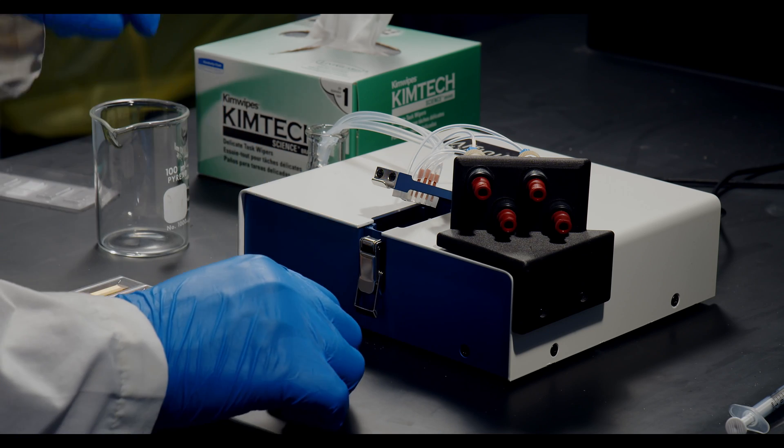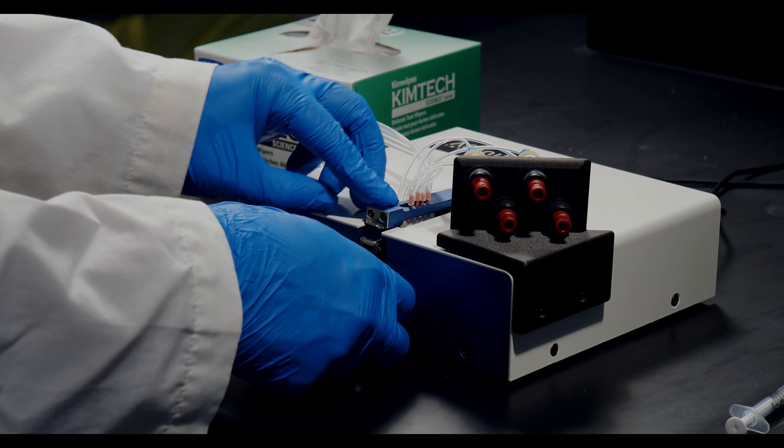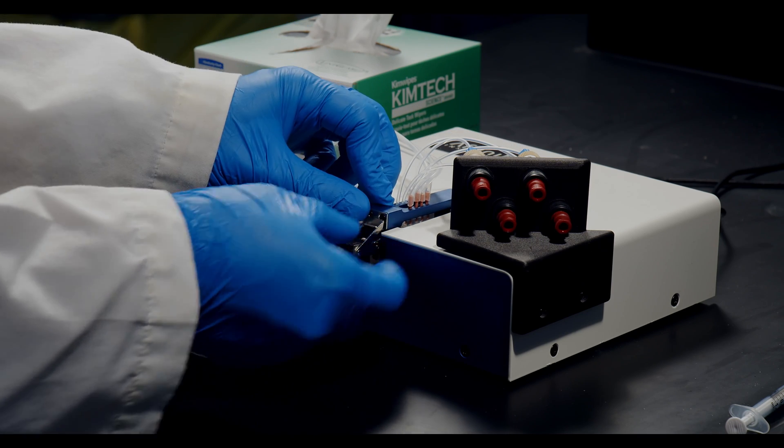And then I'm going to put it back into the instrument, extend the arm downwards, and close the latch.